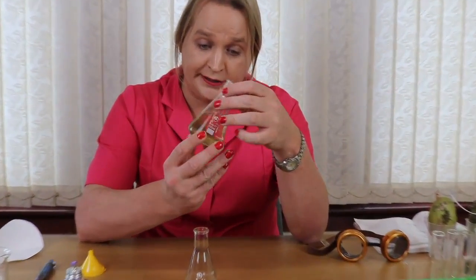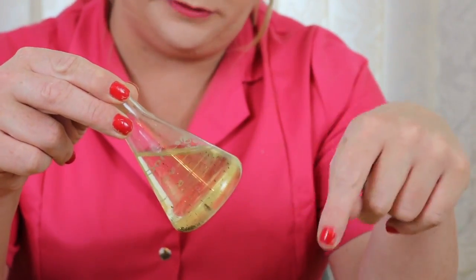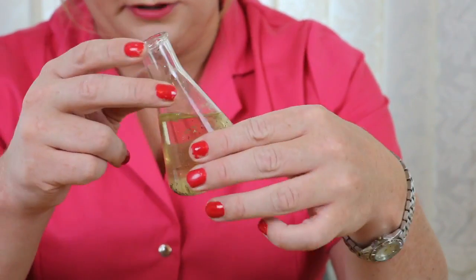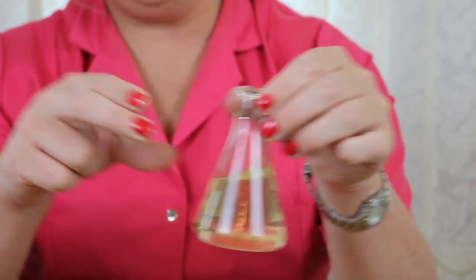The insoluble part is pepper, which is the black pepper you can see floating around, and the soluble part is a salt mixture, and the salt has obviously dissolved. So the salt's dissolved and the pepper's not dissolved. So we've got an insoluble and soluble solution here. What I'm going to do with this first is we need to separate that out.